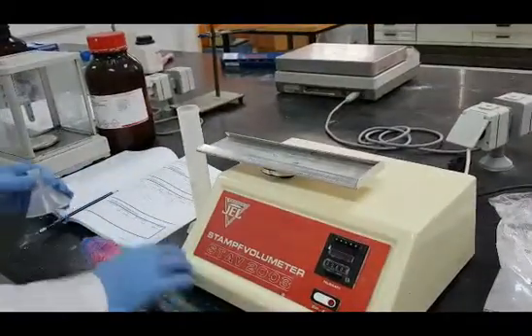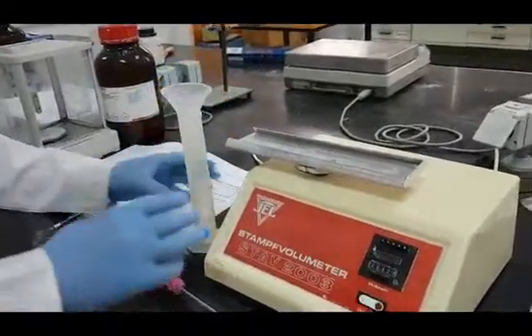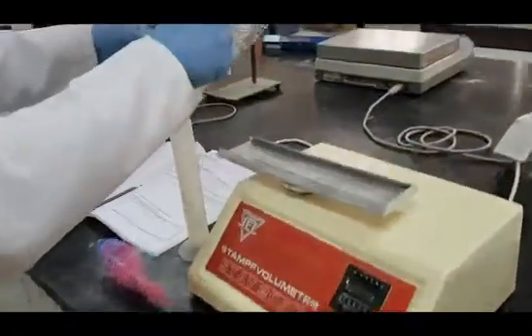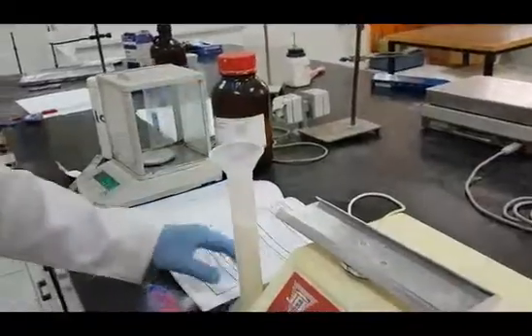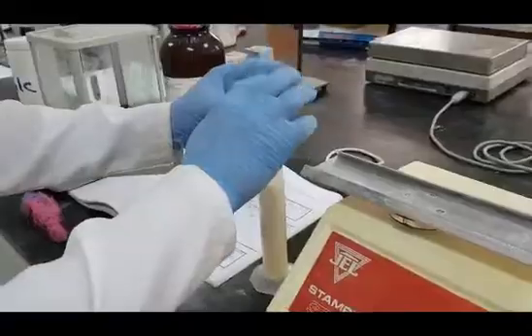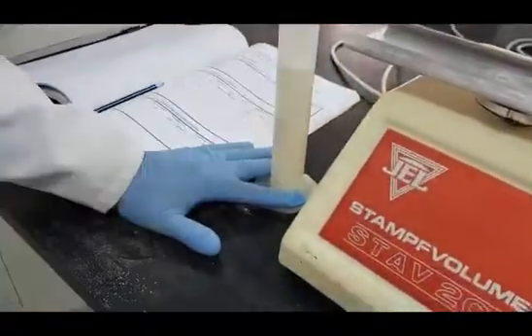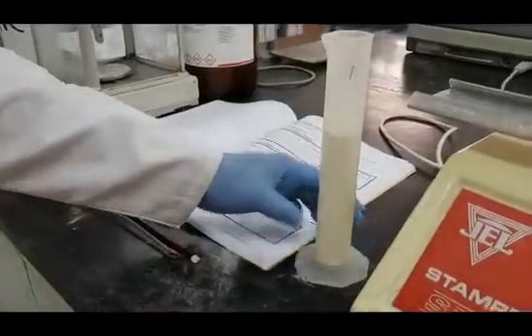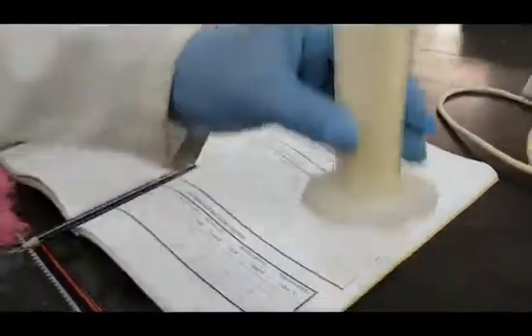Remember, fill or pour the particles inside the measuring cylinder using a funnel and perform maximum 2 taps if uneven surfaces were generated. Then record the bulk volume. After that, zero the bulk density apparatus and start tapping.